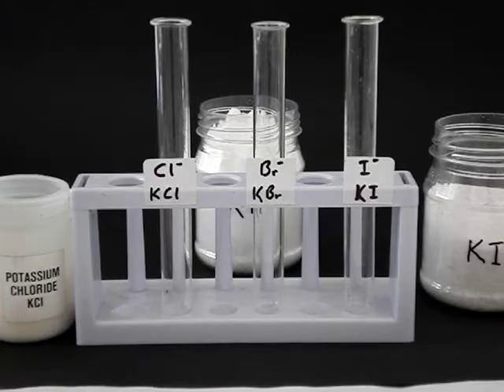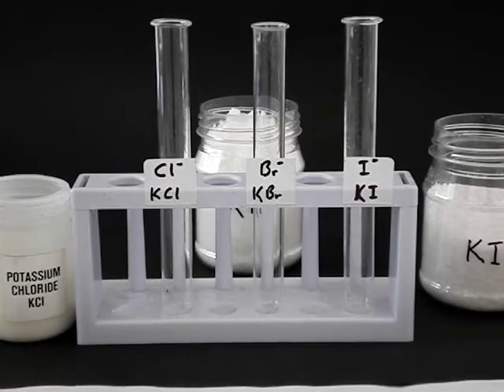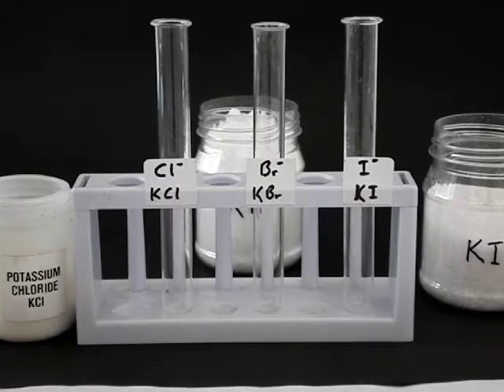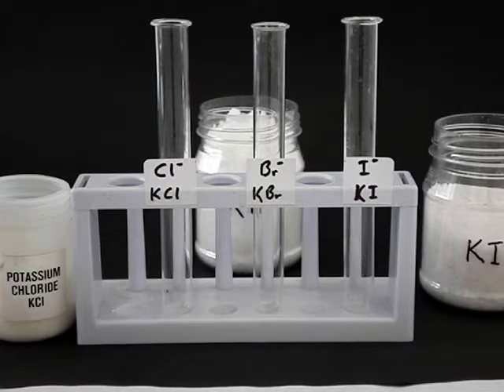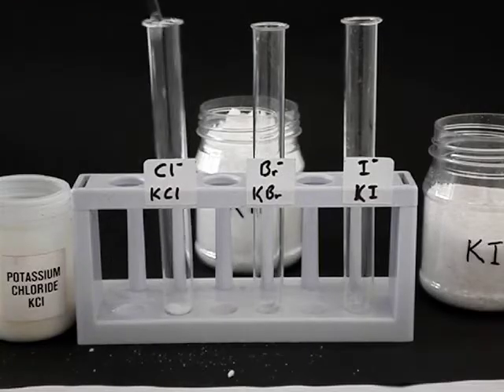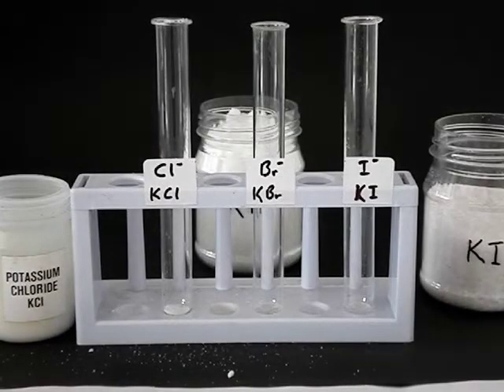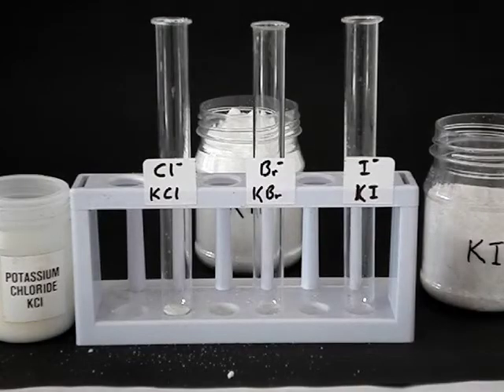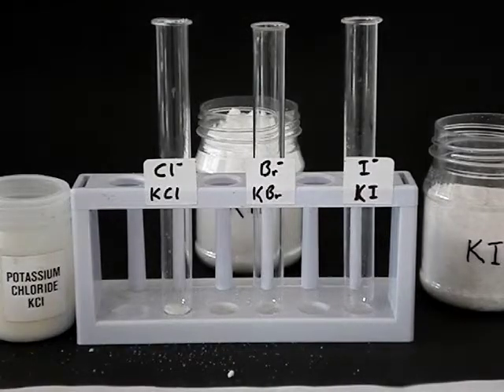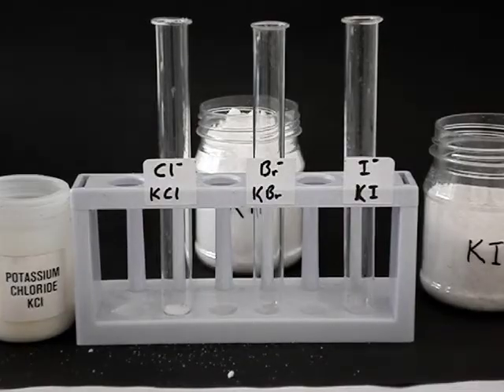Potassium chloride, potassium bromide and potassium iodide are all white powders in the solid phase. If we put some of that in our test tube, we can add some water to it. What you see at the moment is some solid ionic crystal, and that consists of positive and negative ions rigidly packed in a crystal lattice.